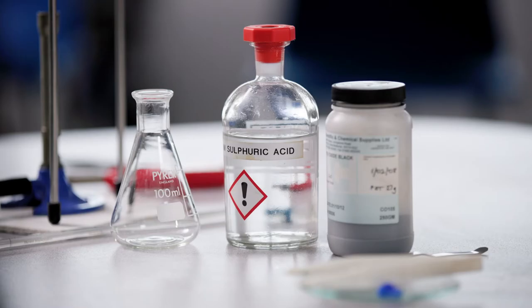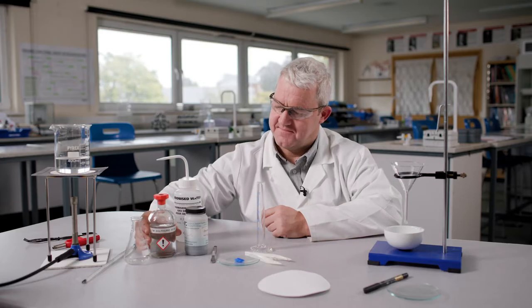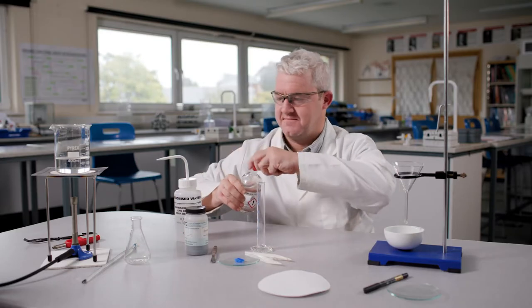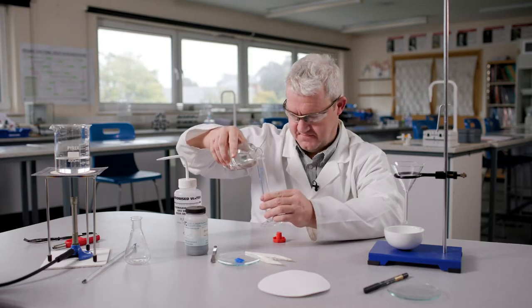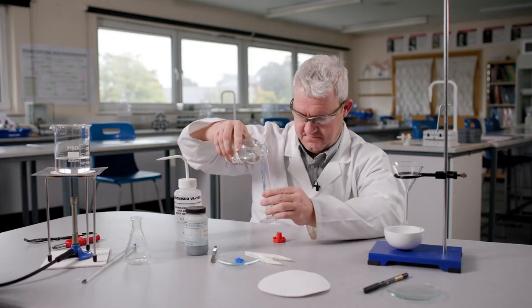In terms of safety in this reaction, there are a few key points to consider. Firstly, dilute sulphuric acid of a concentration one mole per decimetre cubed is used. Therefore, it is important that safety glasses and lab coats are worn. Any spillages on the bench or splashes on the skin should be washed off immediately with plenty of water.